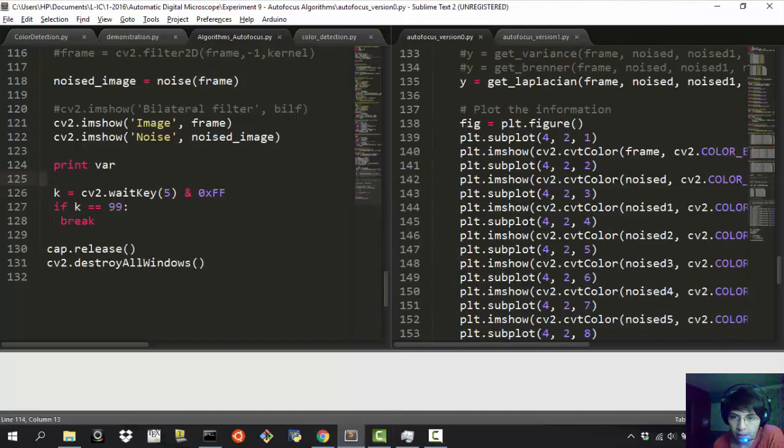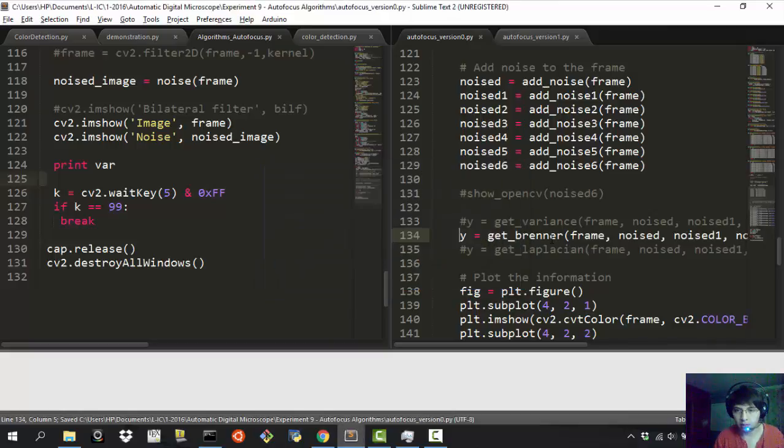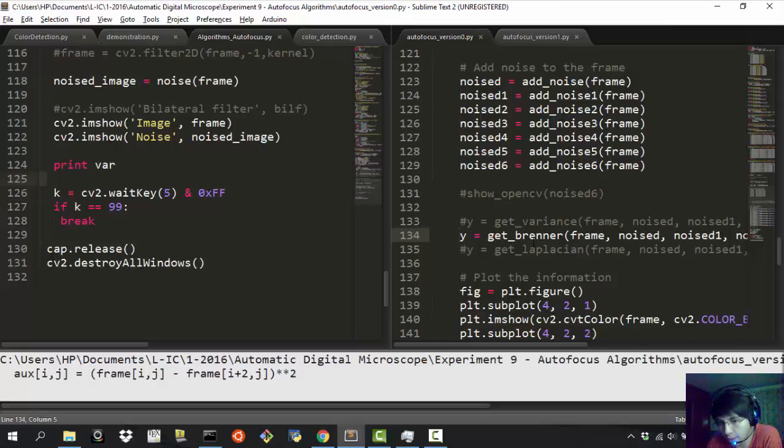Okay, so let's go and comment this, and no, I don't want to do that, and let's start this. Okay, so as this is computing and I have shown you the results, I know that if you know about autofocus, you say, oh, but you should take a lot of images because there are local maxima, and we haven't seen any local maxima.